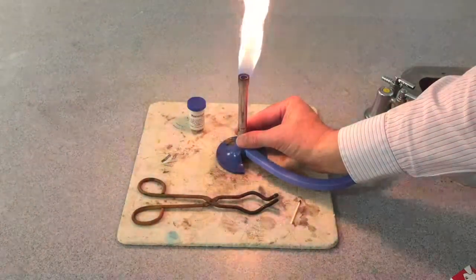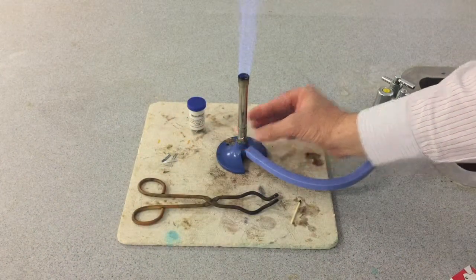The yellow flame is less hot. We turn the collar, and the blue flame is the hottest flame.